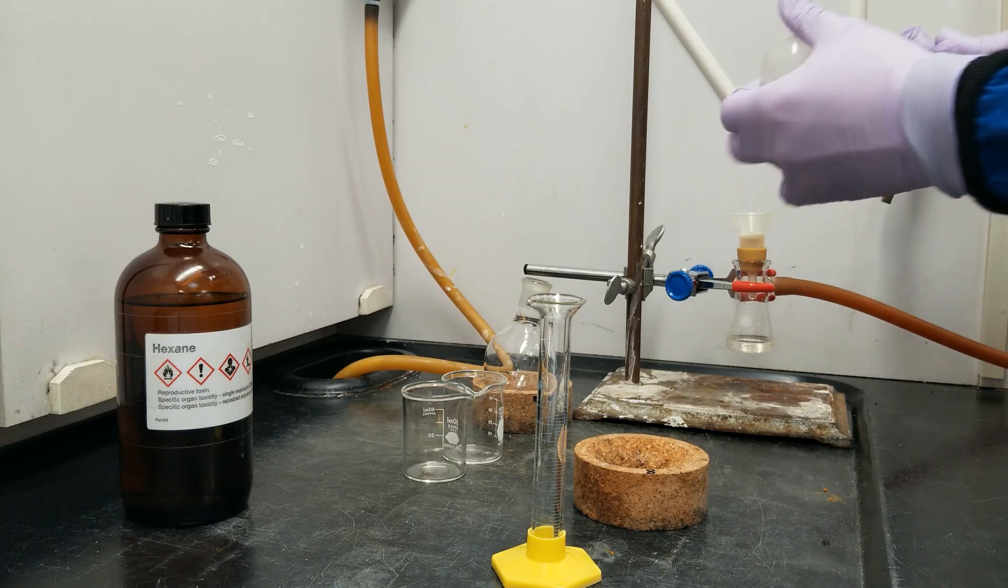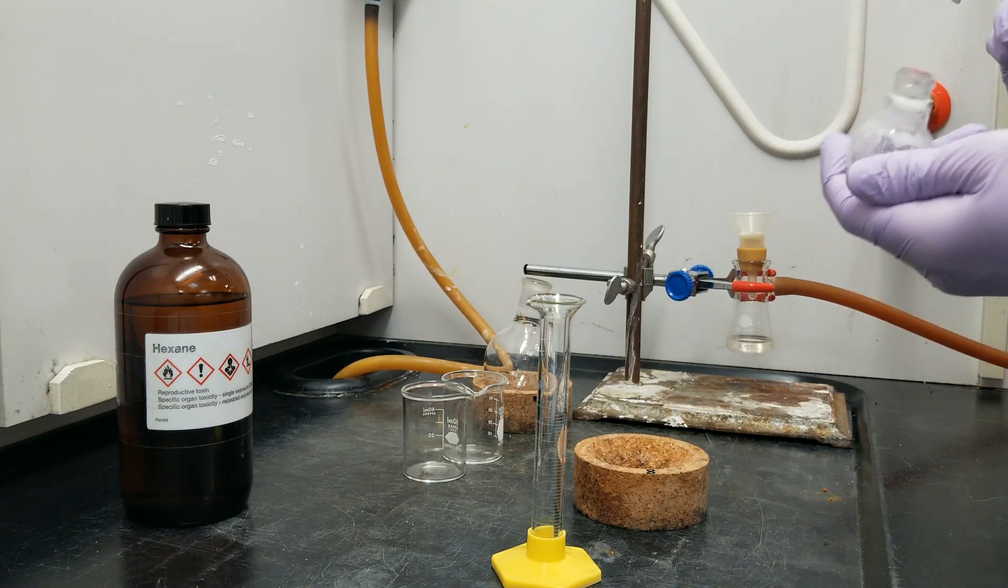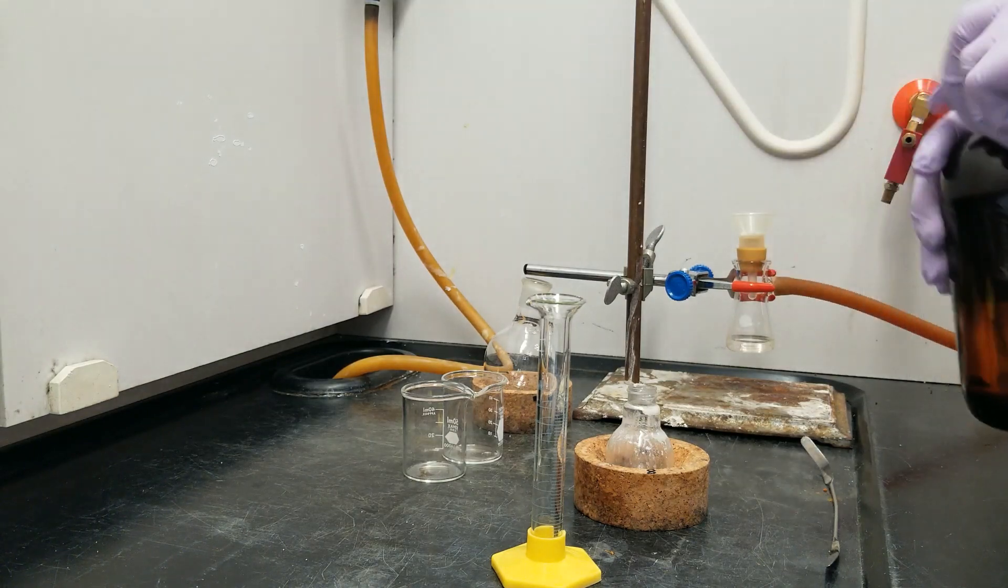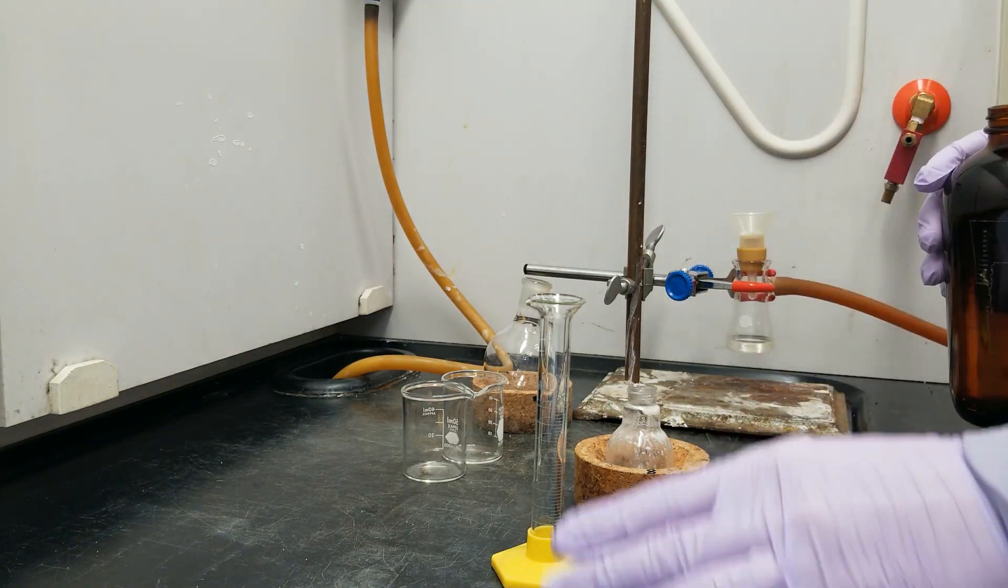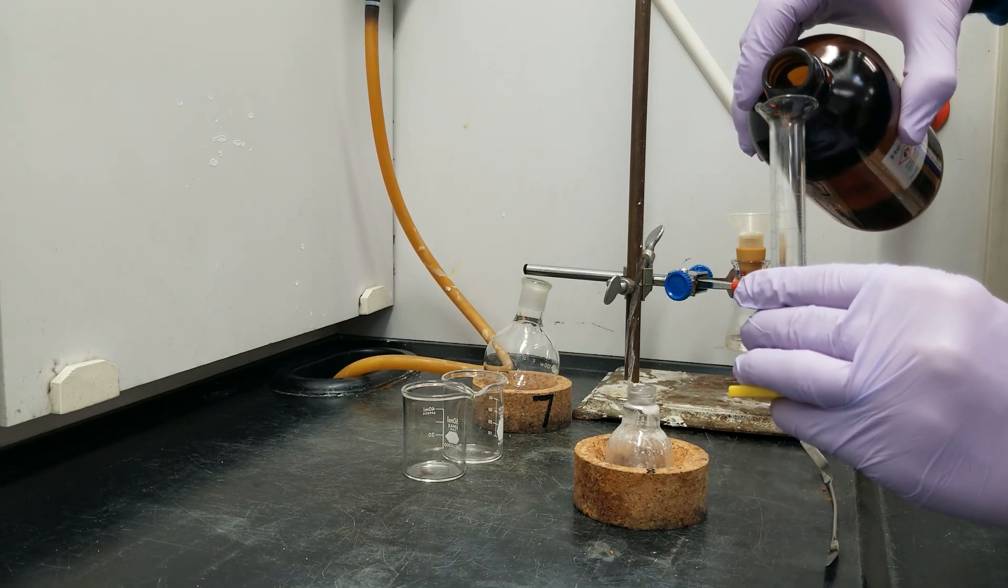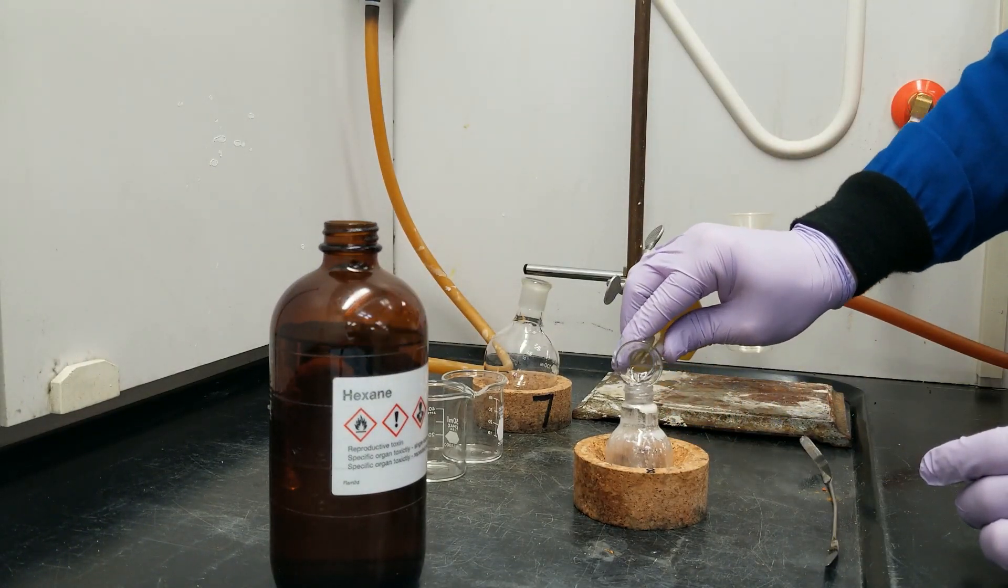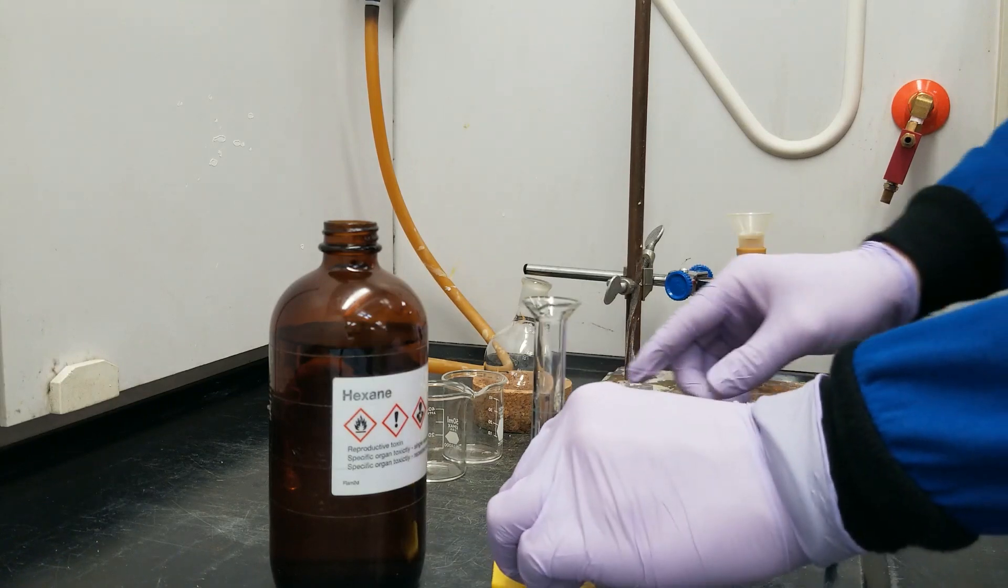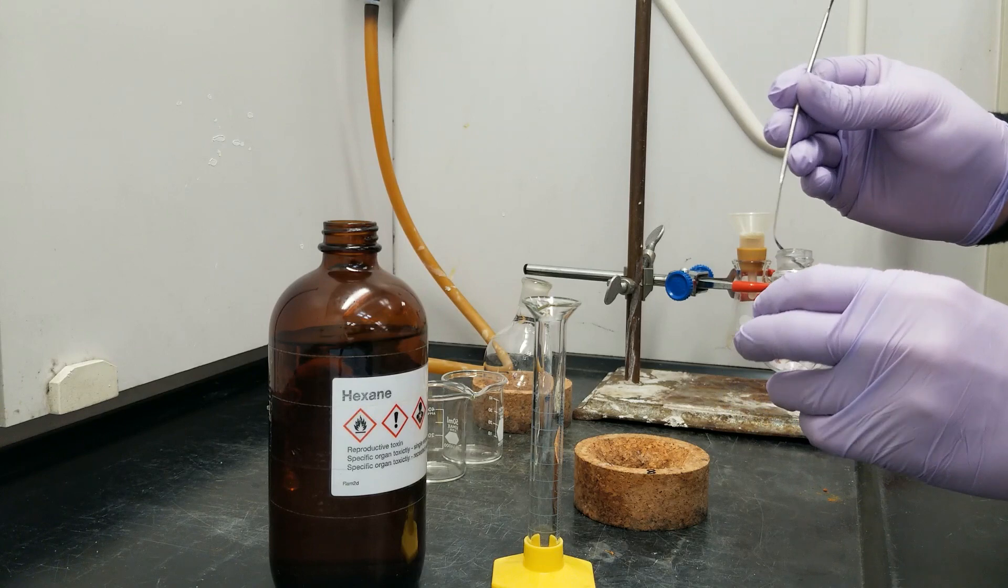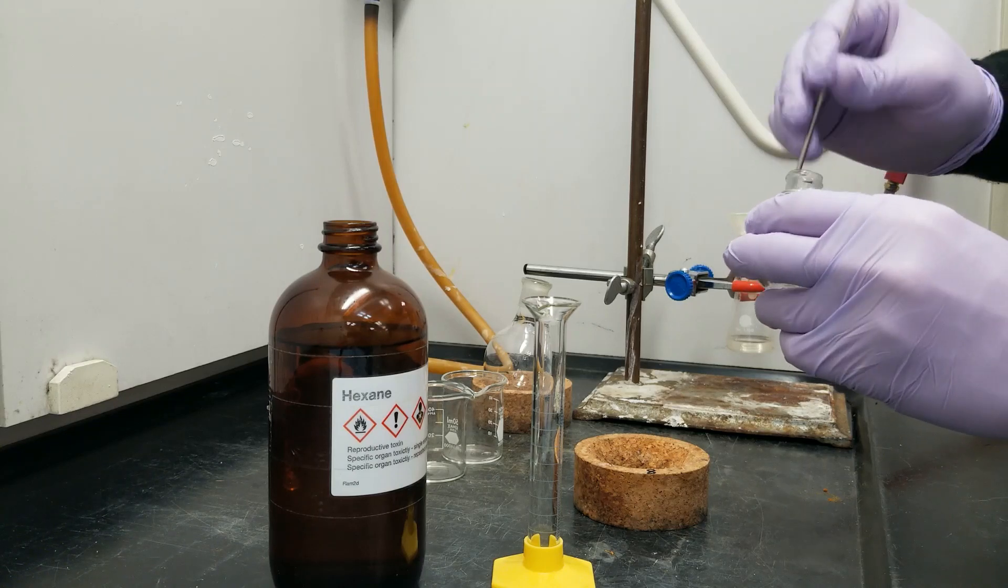So I'm going to do as much as I can with a spatula to try to remove it. But I'm definitely just going to use some additional hexane to get this out of the container. I'm going to use another 5 milliliters.